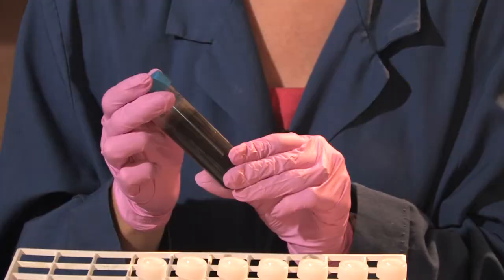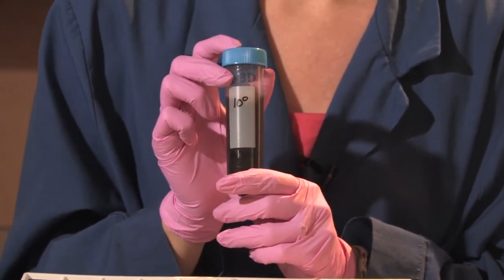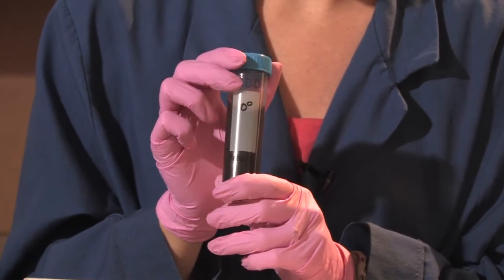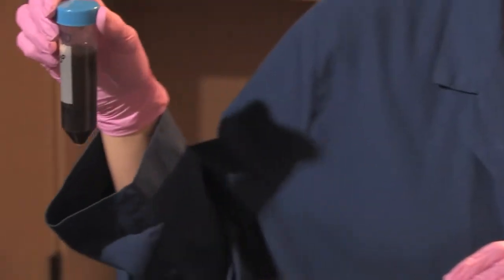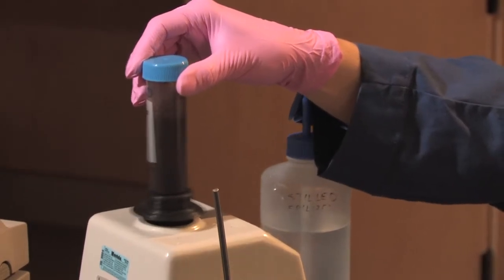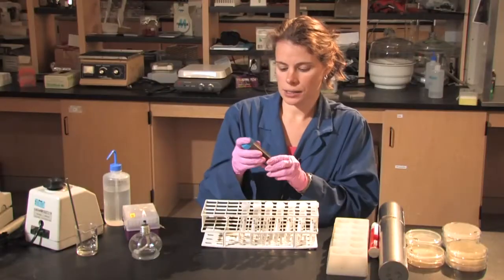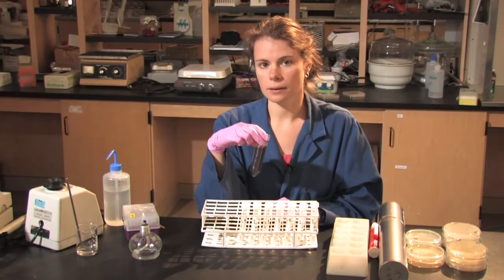I'm currently going to be looking at fungal and bacterial communities within a soil sample. I've weighed 5 grams of soil and added it to 35 mils of water. I'm going to vortex the sample for about a minute, and this spreads apart the soil particles and distributes evenly the communities within the soil.